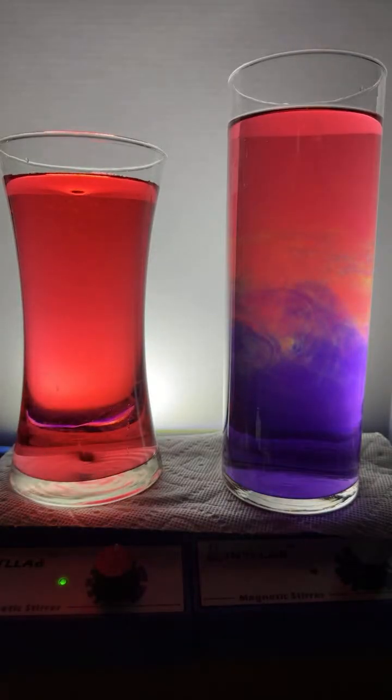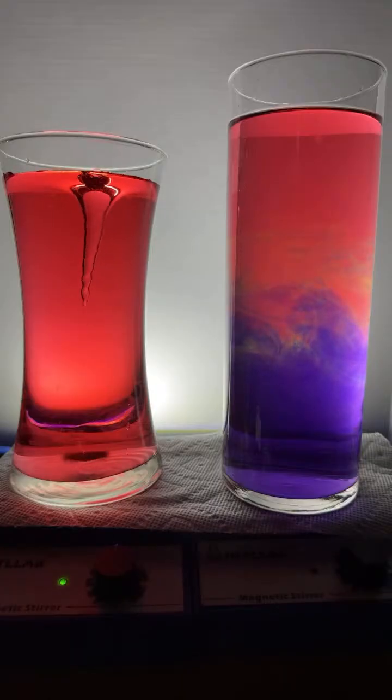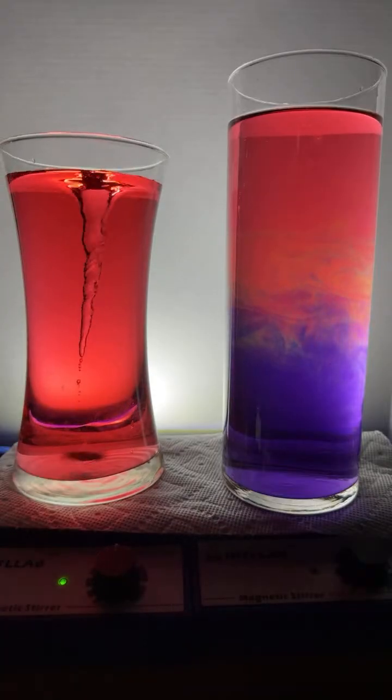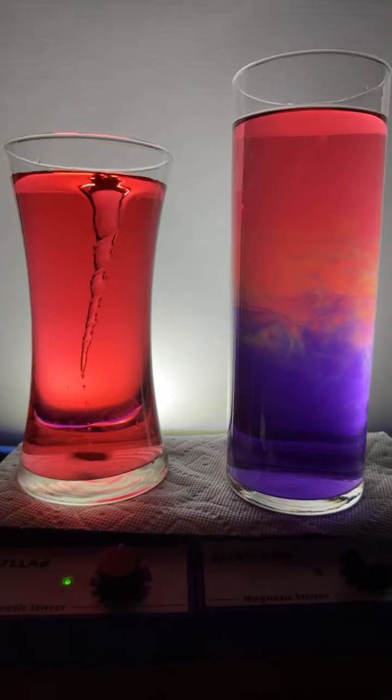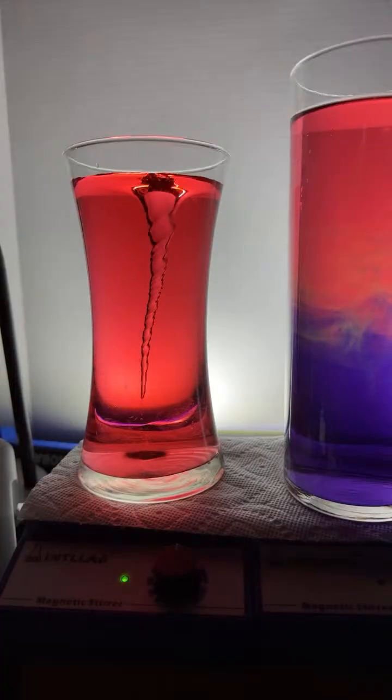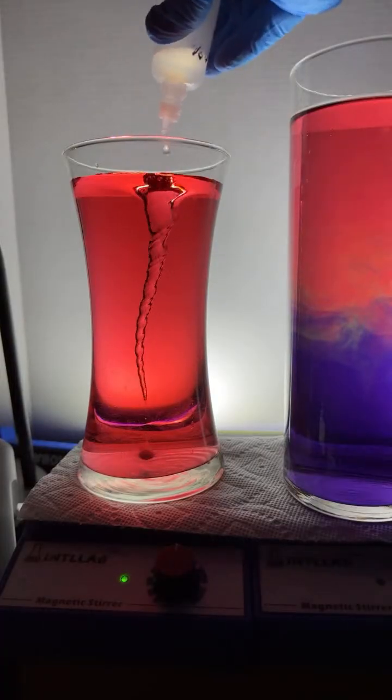That's all I'm doing. I am just mixing acids and bases with universal indicator on the stir bar. The secret for the beauty, I mean, it is absolutely beautiful. The secret is the backlighting. That's what makes everything look so nice, in my opinion. I think about that kind of stuff. Here we go. Let's add a drop of base over here.